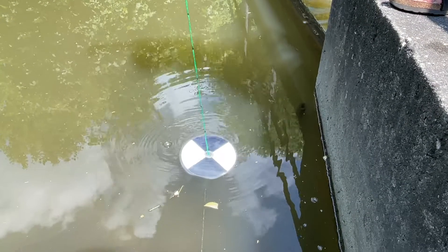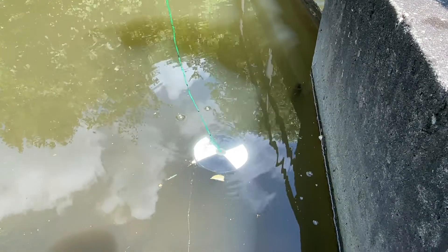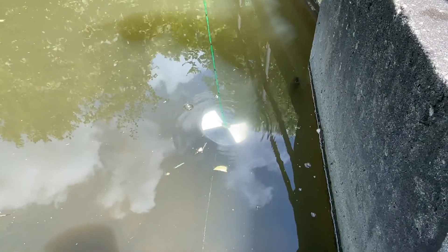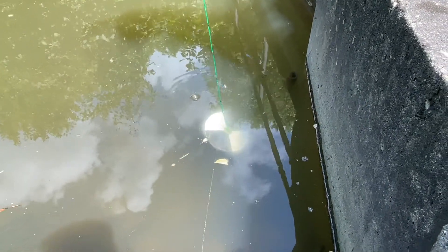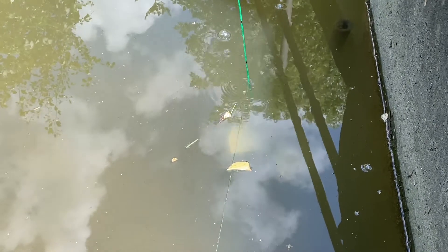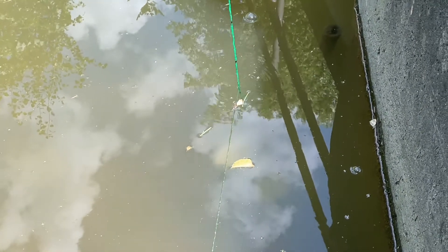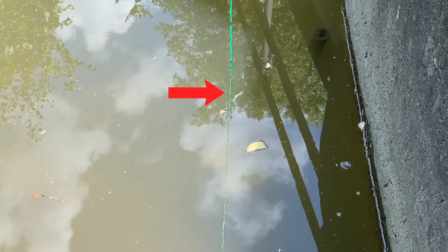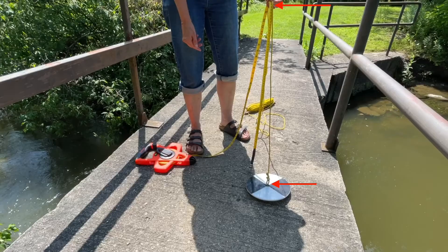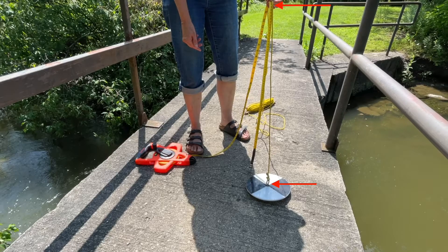To begin, slowly lower the Secchi disk into the water body. You will need to lower the disk right into the point until you can't see it anymore. What we need to measure is the distance from the Secchi disk to the point on the string where the surface of the water was when the Secchi disk was just out of view.